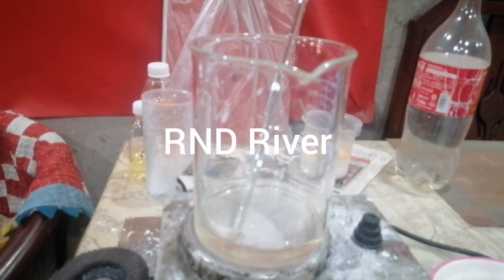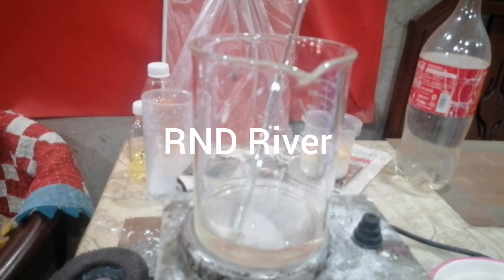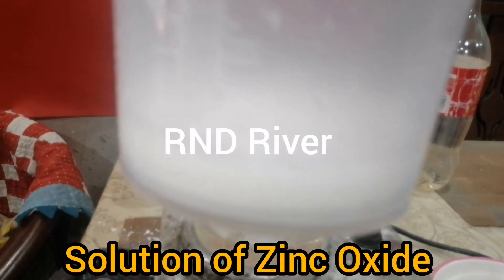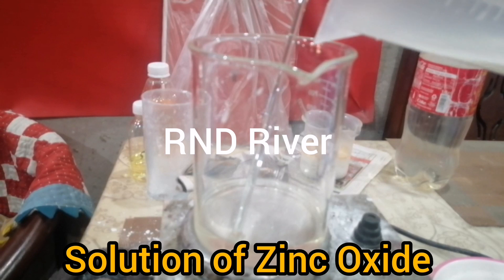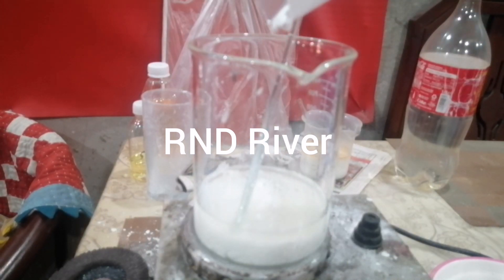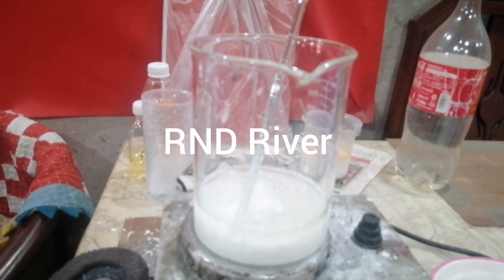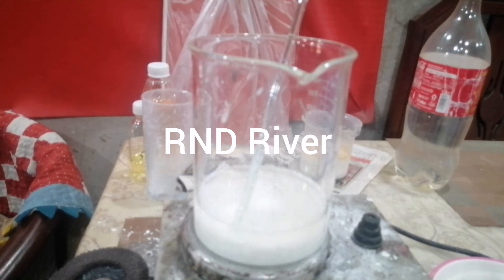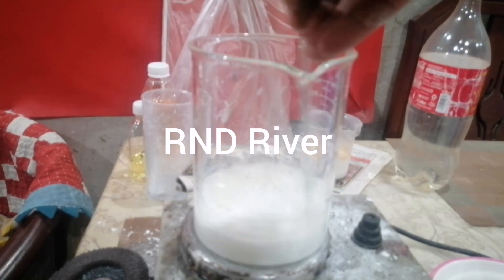As the stearic acid has been melted, then we have to add the solution of zinc oxide. As we add the solution of zinc oxide, the temperature will increase to between 95 to 100 degrees centigrade.